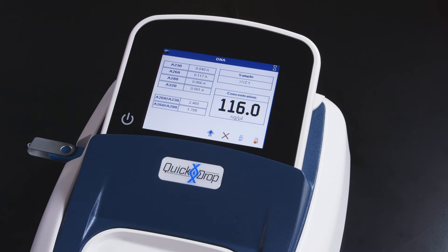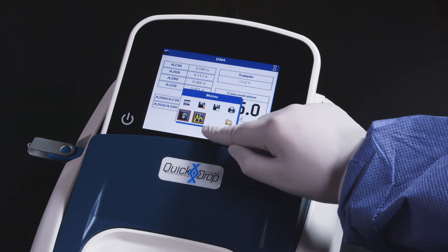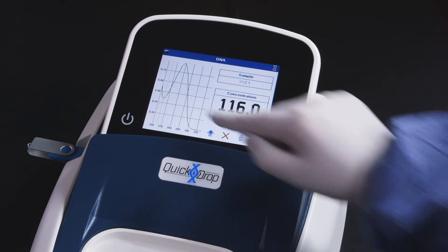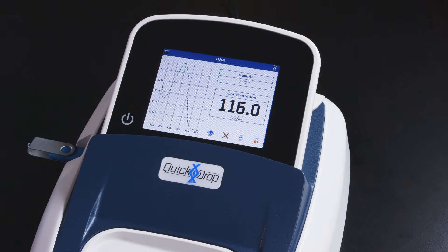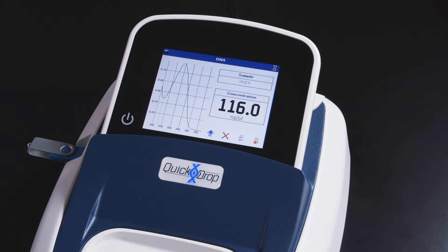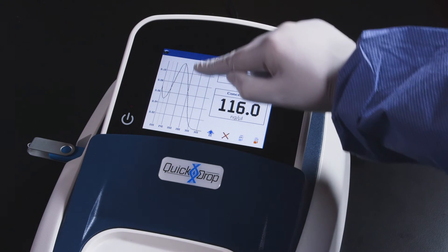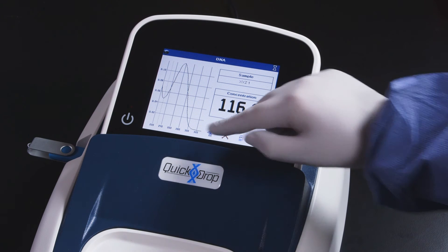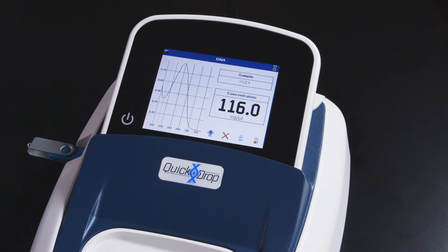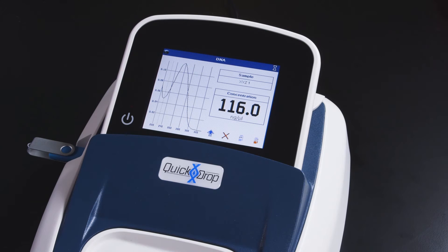The results also include the A260/230 and A260/280 sample purity ratios. If you would like to view the UV spectrum, touch the blue arrow icon, then select the graph icon to toggle the spectrum view on or off. The UV spectrum scan of your DNA sample will be displayed so that you can view any contaminants in your sample or confirm your sample purity.